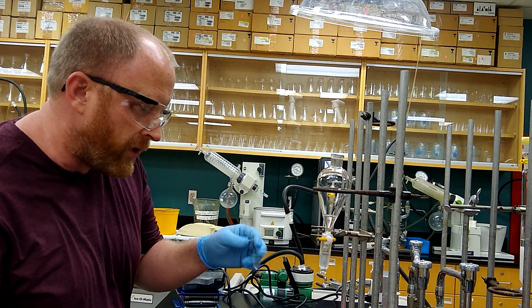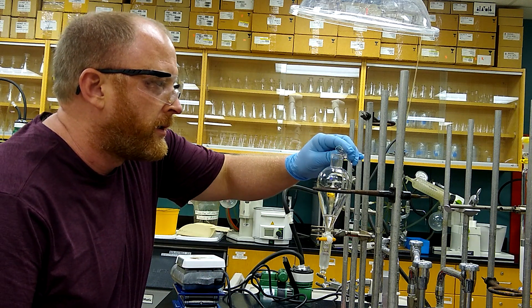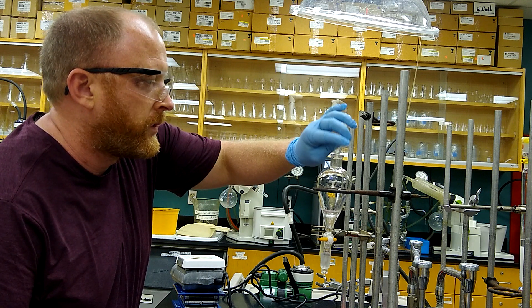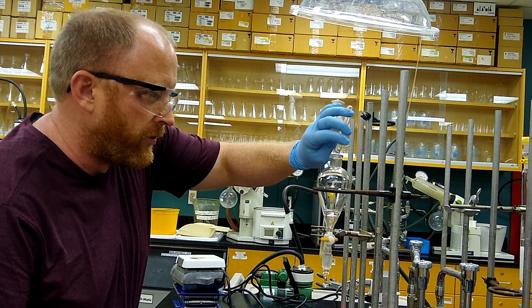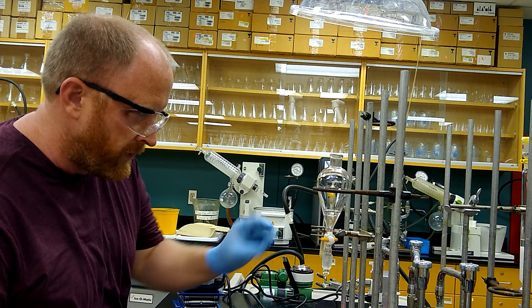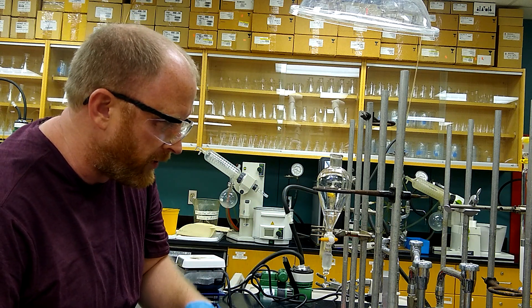Now with the leftover ether layer, I'm just going to add some distilled water. We're just neutralizing the pH a little bit, getting rid of some of the base because we used sodium hydroxide.